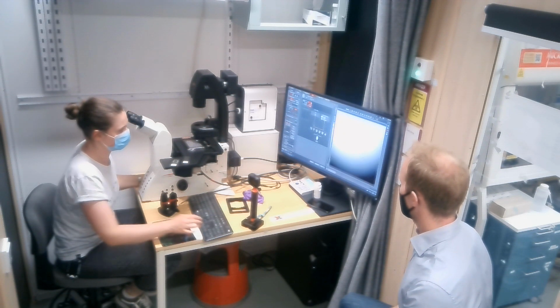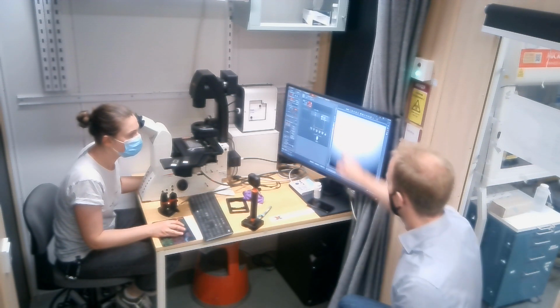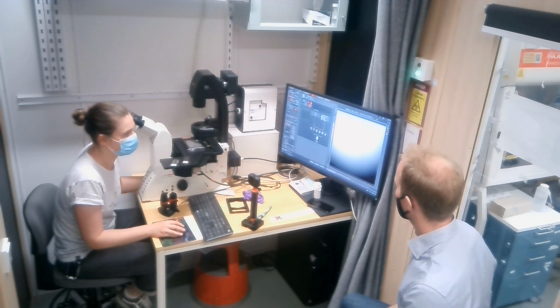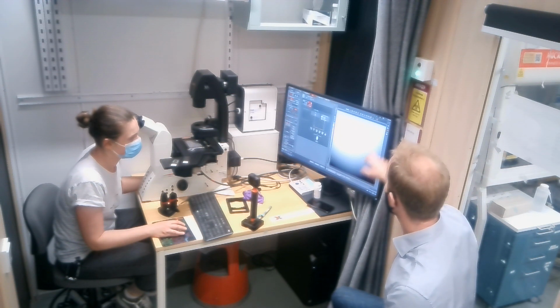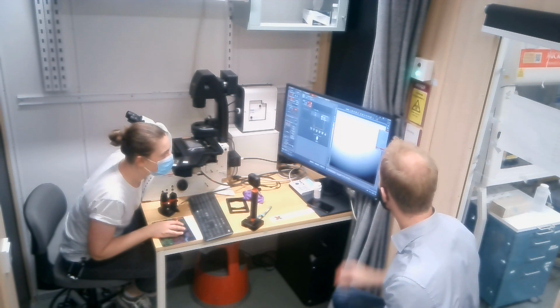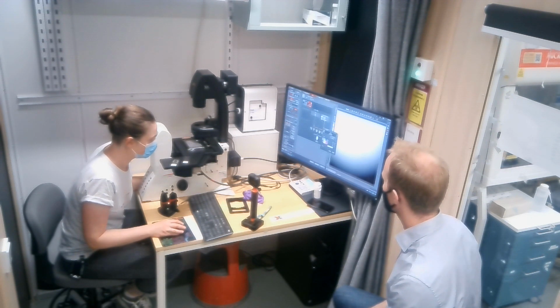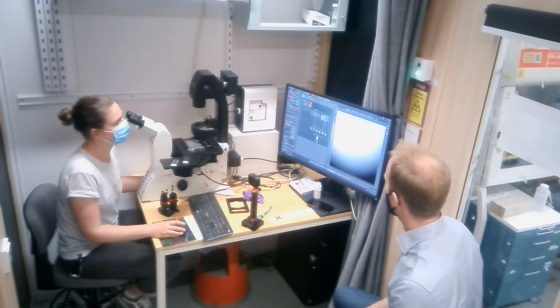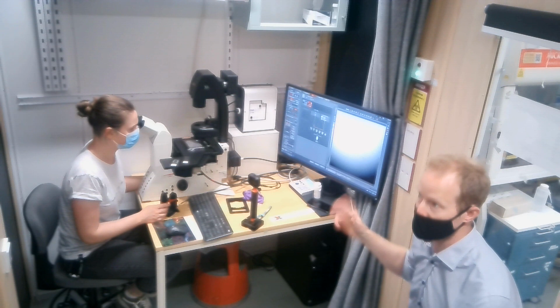Within the process? No, you can also add scale bars and measuring things here. And that's that one. If you click on that one, you can draw it wherever you want it. And it's written there, okay. Can I change the color? With that one, I'm not 100% sure. If you take the selection there and right click on it, I think you could find properties. It's up a little bit there. And then you have colors there. So that's something you can also use if you want to do simple measurements in your image. You can use the scale bar.